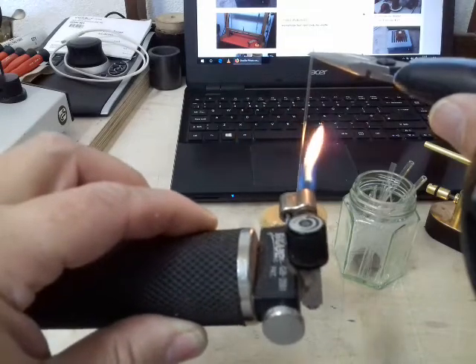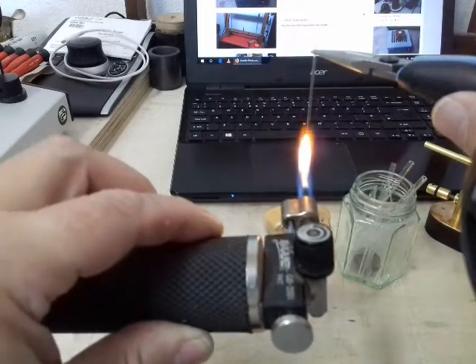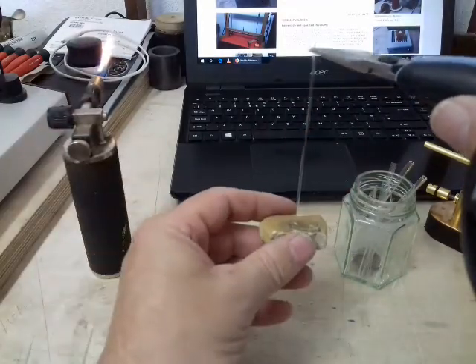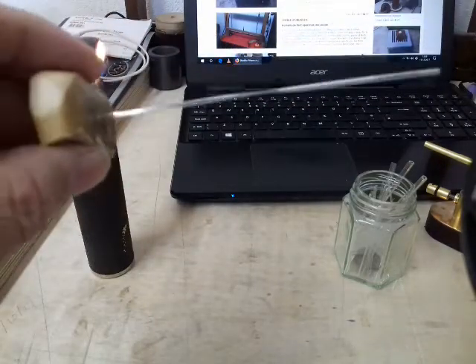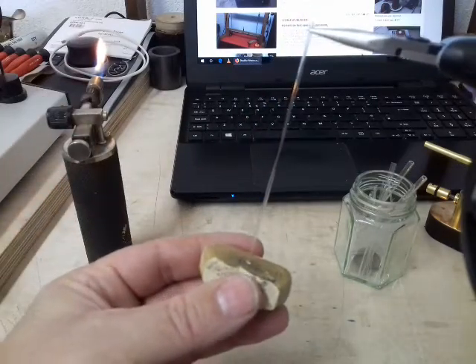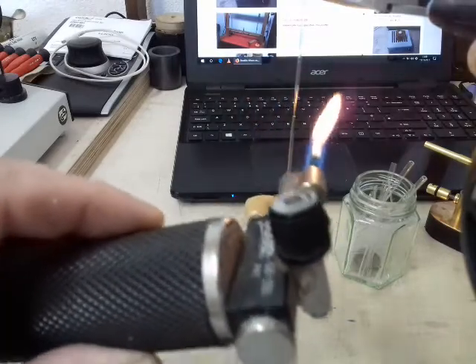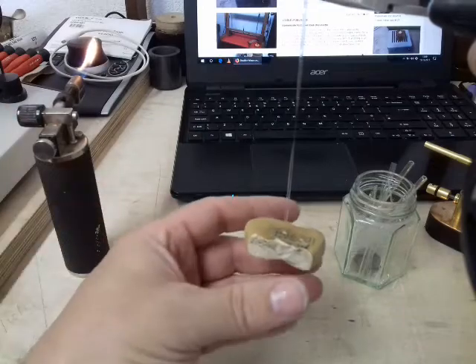As the flame softens the glass, it starts to drop. And there we have it, a stretched needle. And if you think it's on the thick side, you can actually put it back into the flame and be ever so careful this time, because it's a lot thinner, so it doesn't drop off. You can carefully manipulate it like that, and you've got a very, very fine needle now.